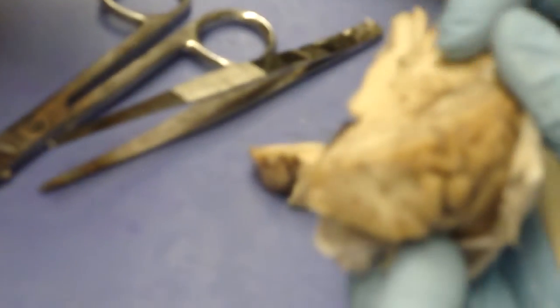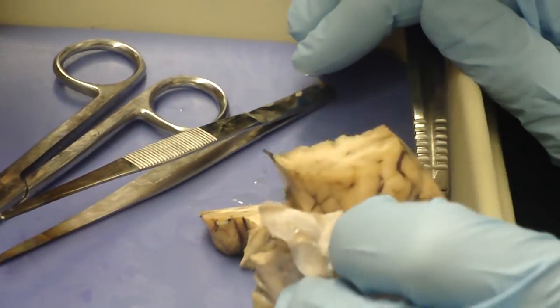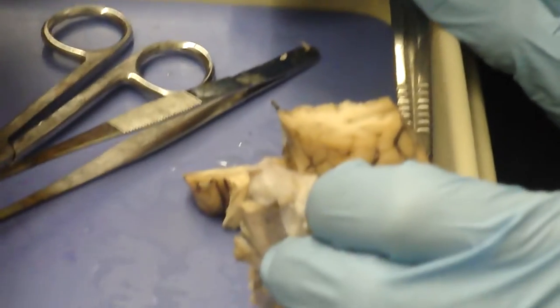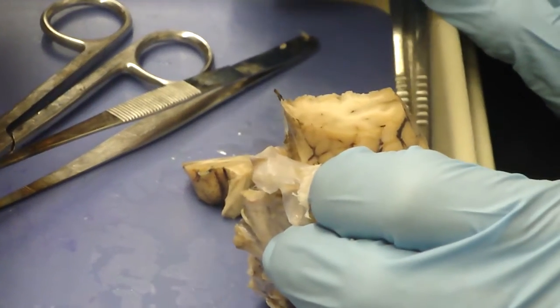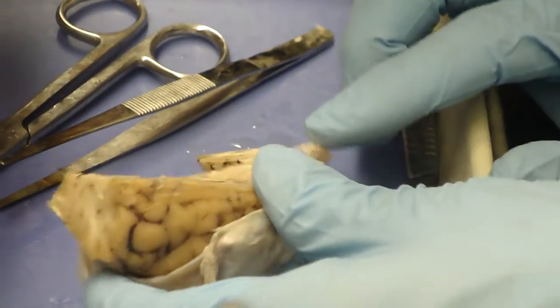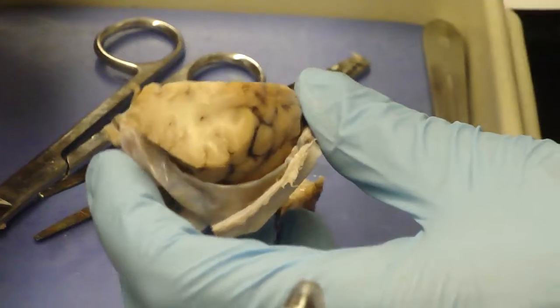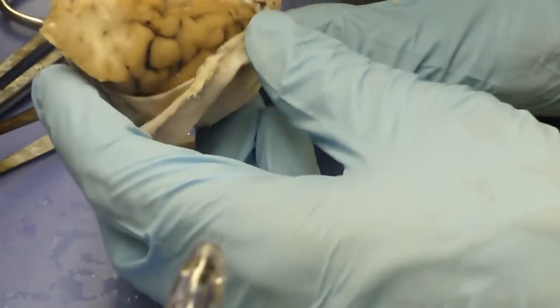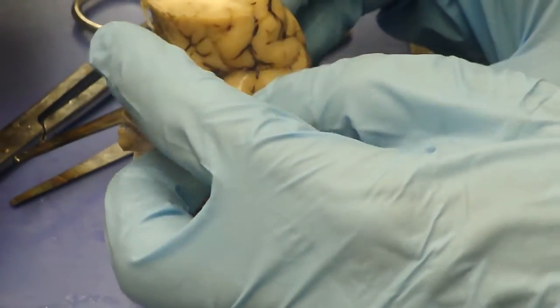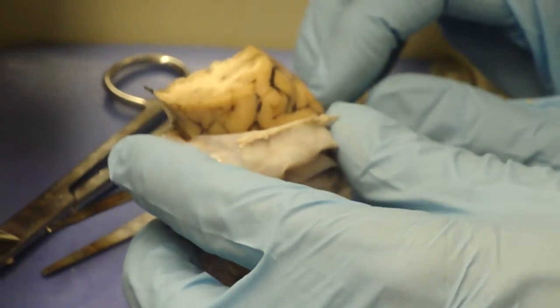It matches the colors of the cerebellum, with white matter inside, gray matter outside. Primitively in the nervous system, white matter is outside and gray matter is inside. That's what you find in the spinal cord. And evidently the migration of gray matter to the outside is something that has taken place in brains where there's a bit more activity. What's going on in the cerebral hemispheres would be a process of association of information.